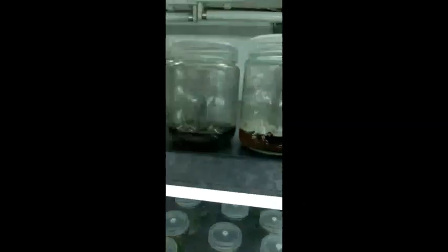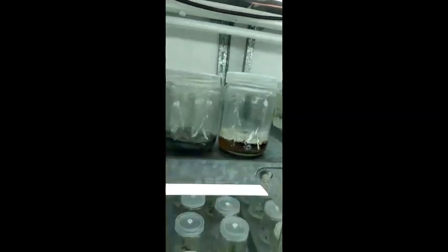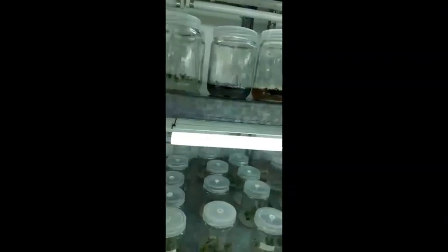Contamination may be caused by microorganisms, fungal as well as bacterial. Those contaminations are isolated through observation. The other problem is defoliation. Defoliation may be caused by mineral nutrients as well as other agents, and as you observe in this video, necrosis is there and defoliation is also there. Those problems cannot be solved by our capacity.